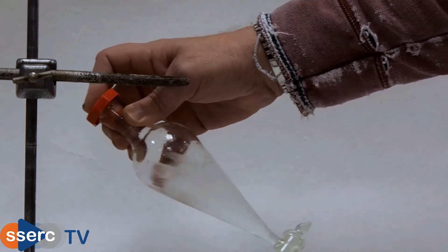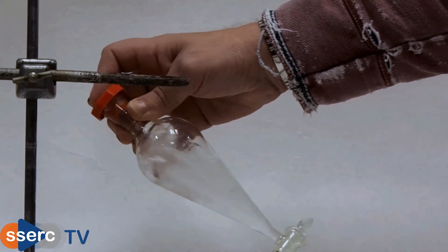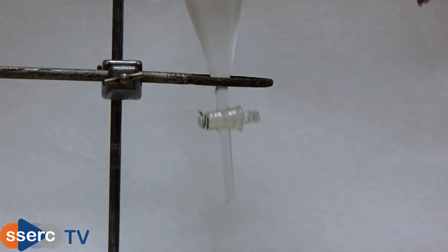It is important not to shake too vigorously or you risk forming an emulsion which will stop the layers from separating out again.